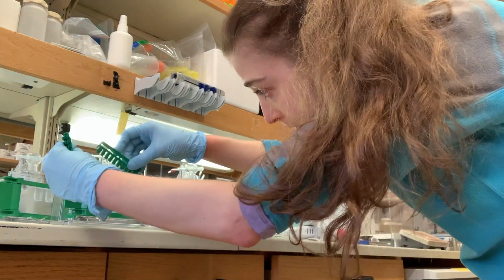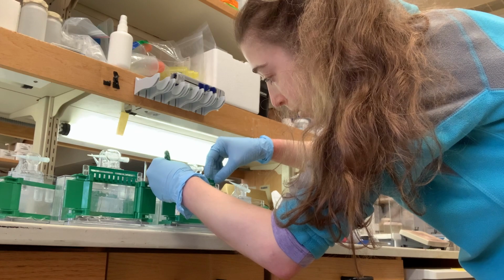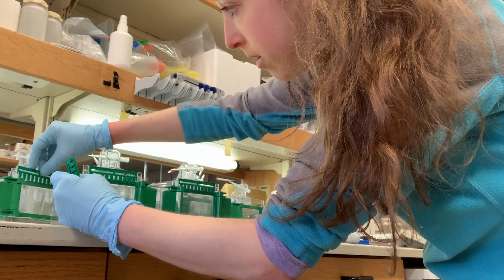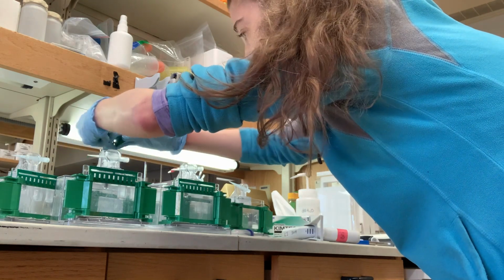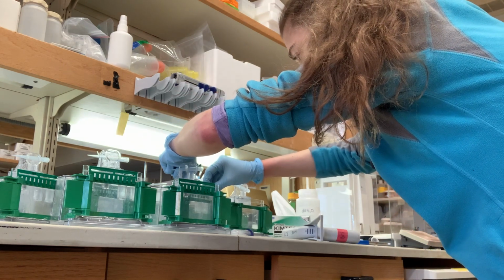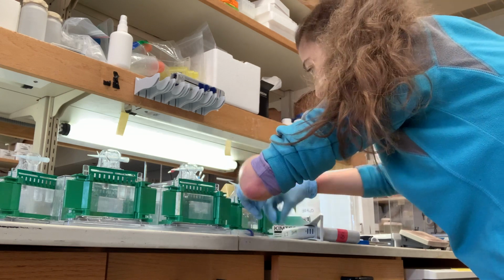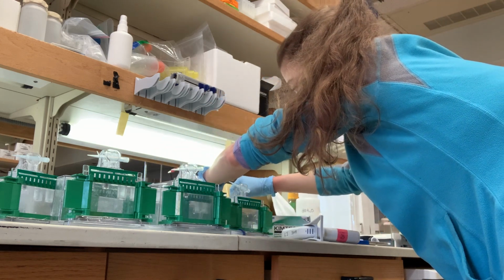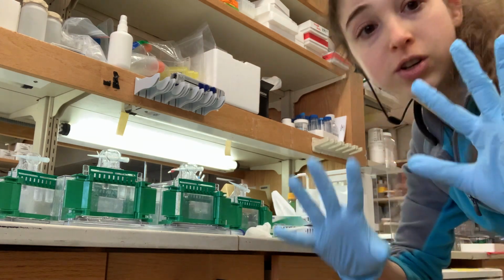And then you just insert your comb, so start from the corner, just go down. I'm just going to spill over. A thing to note about this is that polyacrylamide is toxic before it polymerizes. So you want to be careful and wear gloves and clean up well. You want to avoid there being anything stuck or any bubbles in between the wells. That'll warp things. So you want to do this quickly so that it doesn't have time to polymerize before it's done. Okay, so now this is going to set, and I'm going to go change my gloves and clean up.